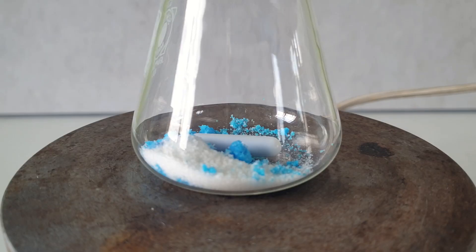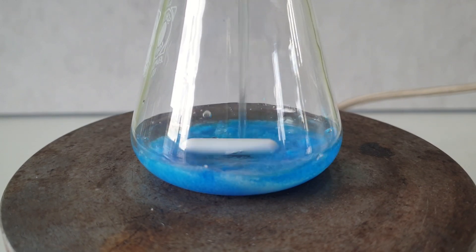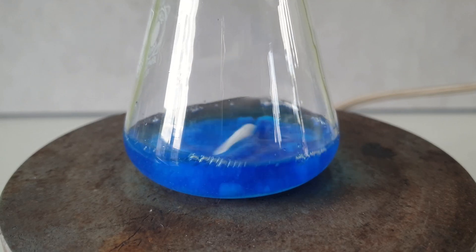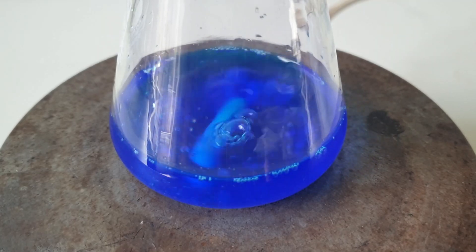Then I added 25 milliliters of water and started heating the solution. The temperature doesn't have to be exact, but it should not be boiling. About 60 to 70 degrees celsius works well.